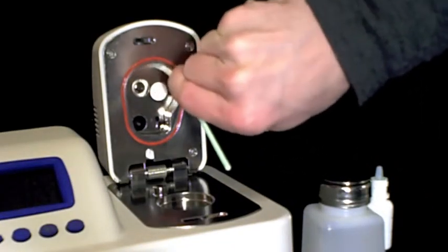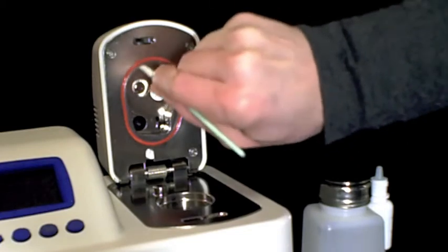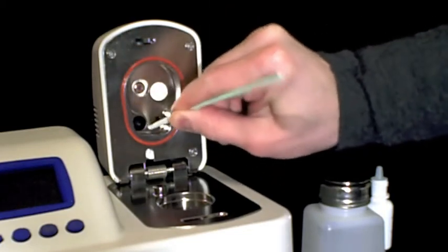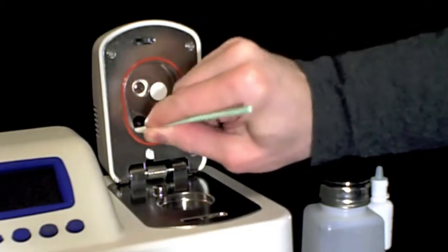Using the kimwipe and the rod, clean the upper chamber of your Aqualab, the o-ring, and all surfaces of the block.